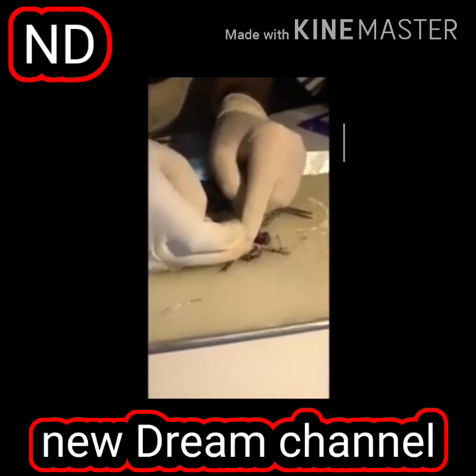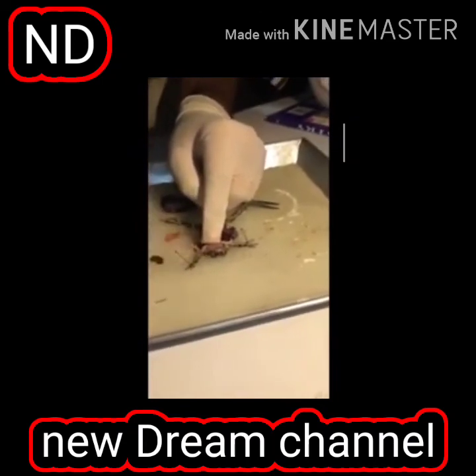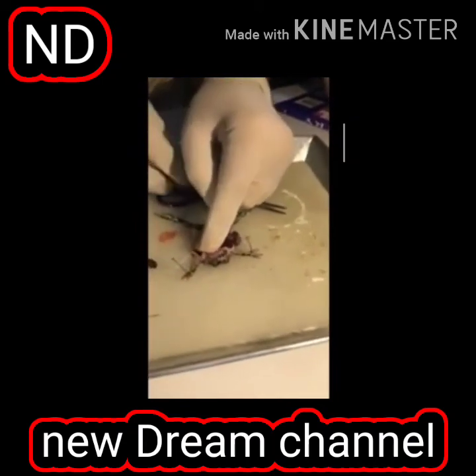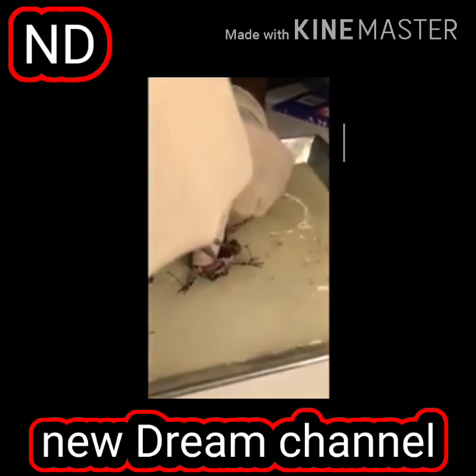And this lining, you see, this is the buccal cavity. This lining is called the buccopharyngeal lining. And this in frogs helps in respiration.